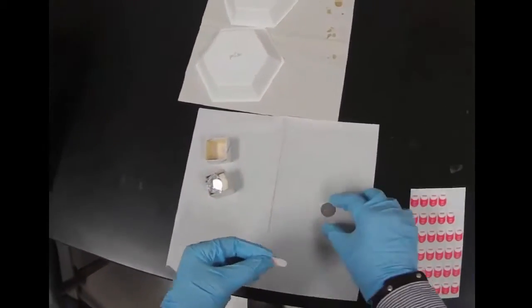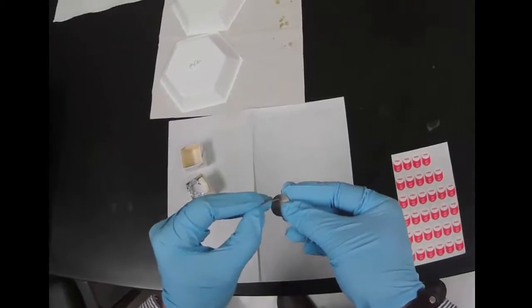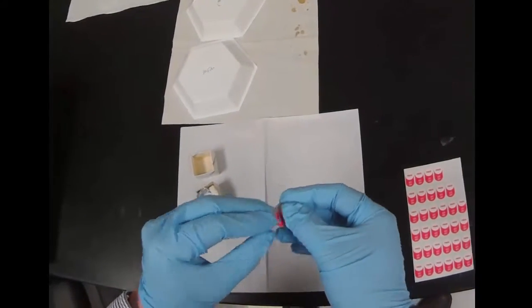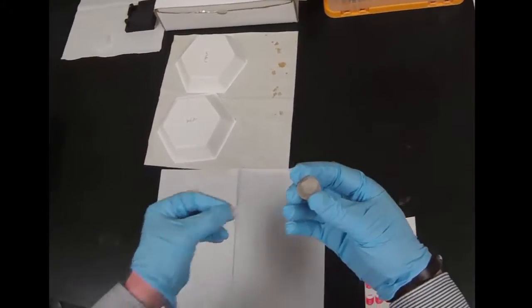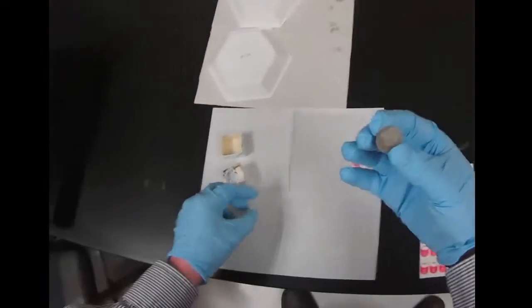We want to stick the cover slip to the steel, so we're going to use one of these sticky tabs. Just like it says, press and then lift off. That leaves some adhesive on the steel.